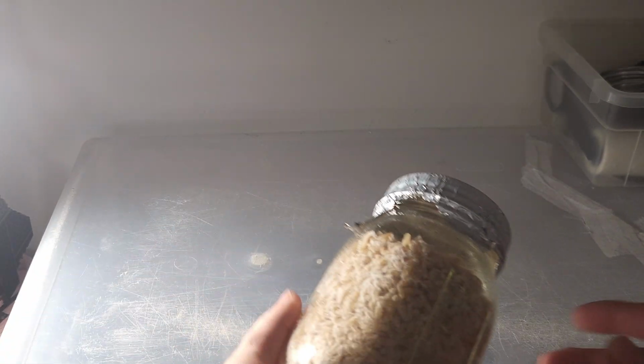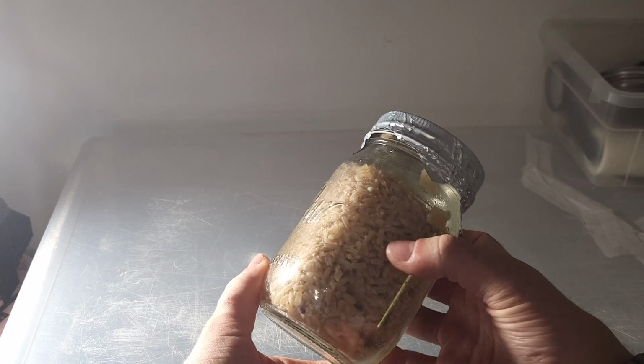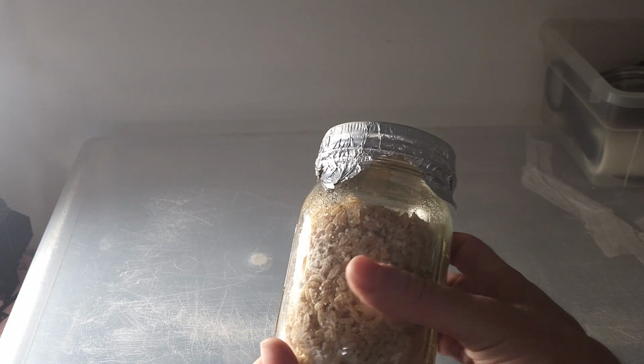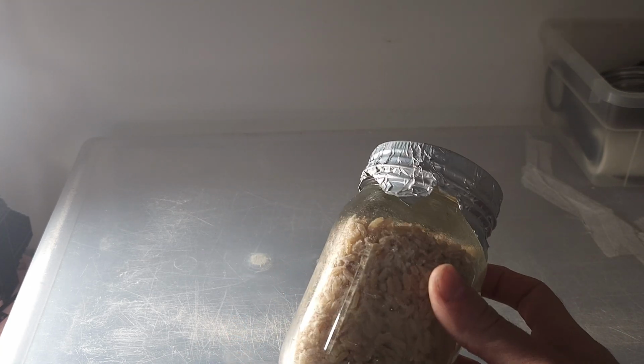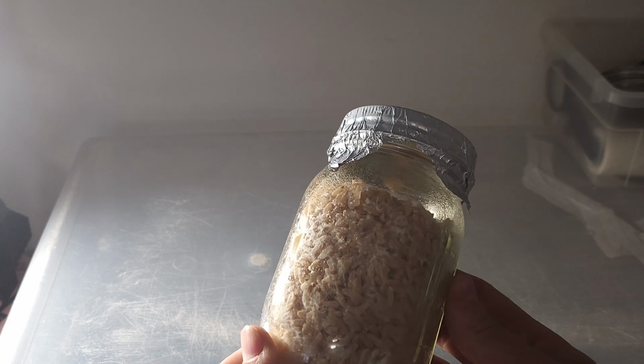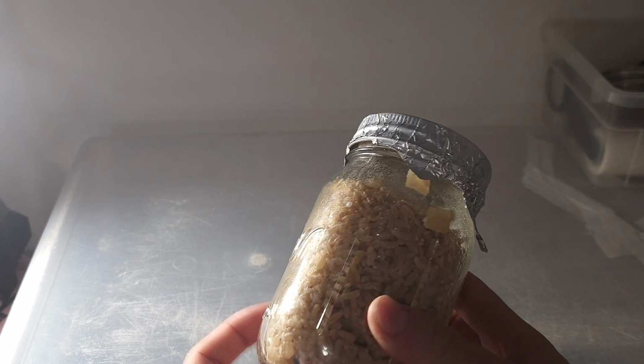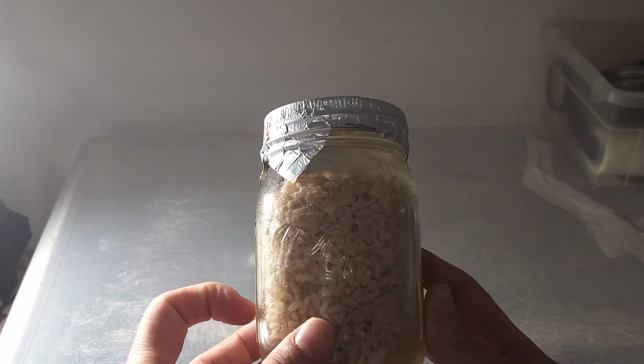Now, let's take a look at a success story. Here, we have some fully colonized lion's mane. This is very hard to tell because of how thin and wispy the mycelium is, but you'll start to see it clumps, which actually means I've let it go for too long, and we will be spawning this to bulk here very soon.